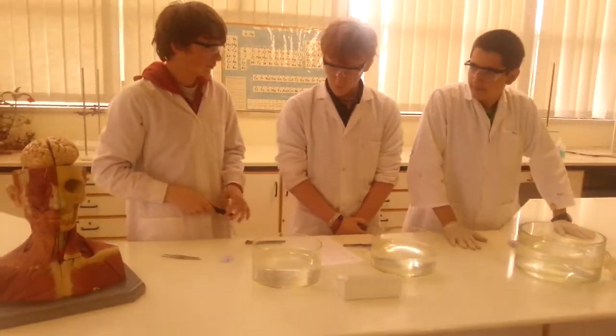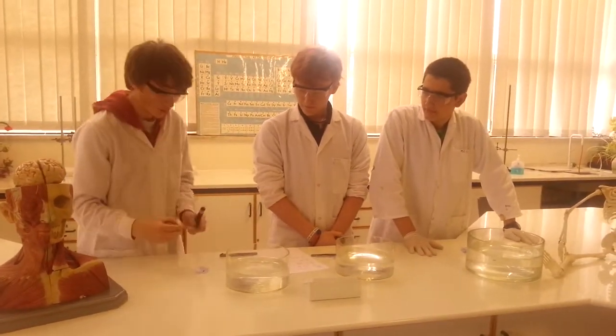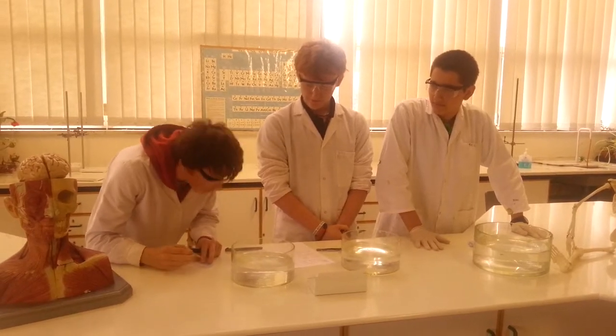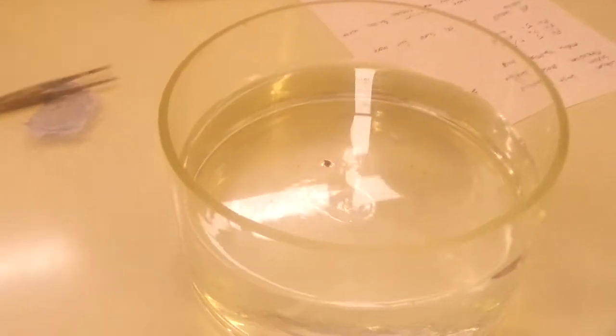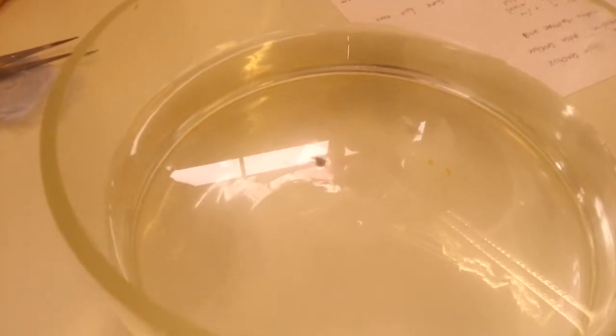So, Damon, if you want to put lithium in first into the water. Do I actually put it in? Yes, that's what I just said. As you can see, it starts to change the colour of the water because we put in universal indicator.